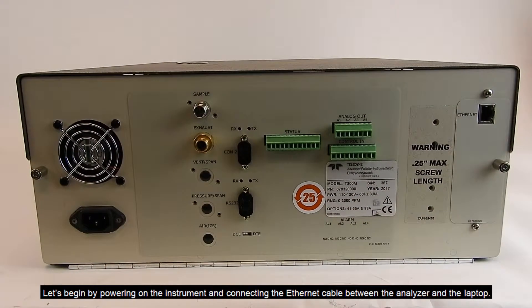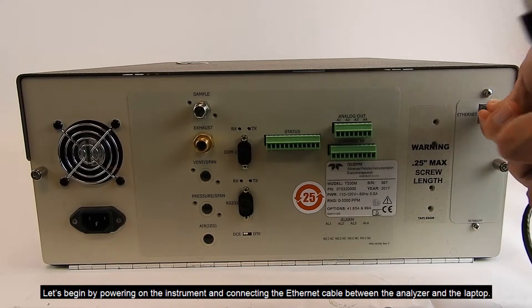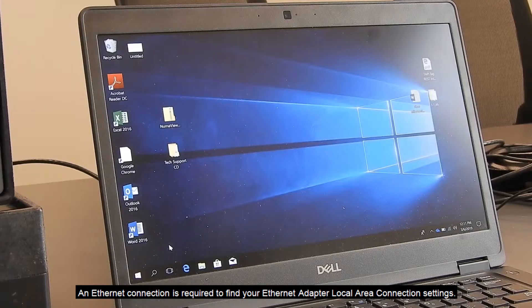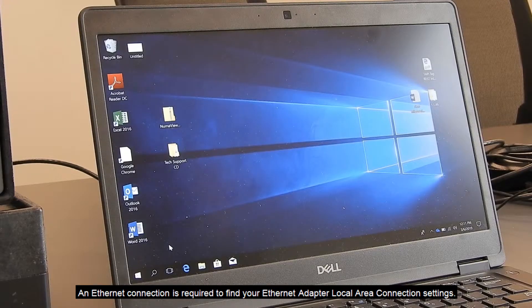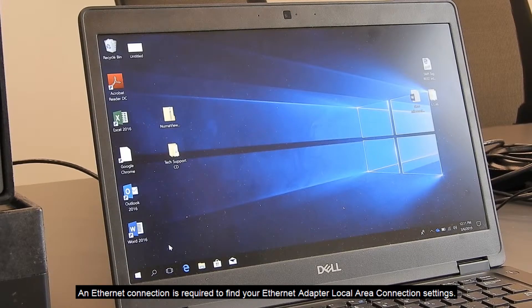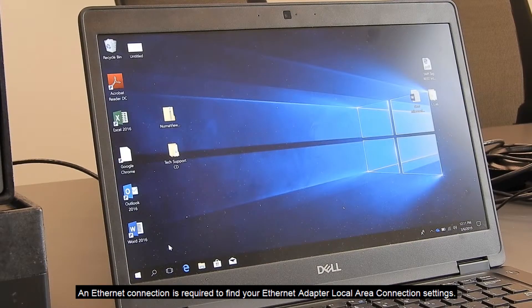Let's begin by powering on the unit and connecting the Ethernet cable between the analyzer and the laptop. An Ethernet connection is required to find your Ethernet adapter local area connection setting.